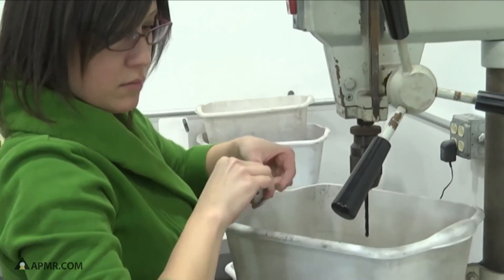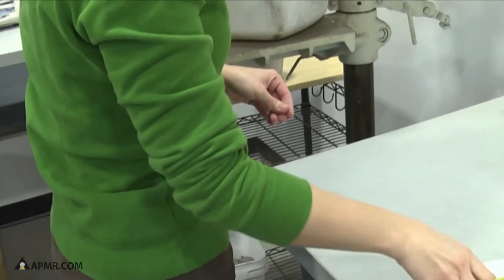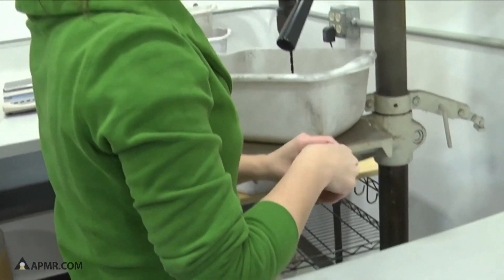Now we're going to drill the bottom side of the bar, get our sample out of the bottom, and collect those shavings in the bag marked B for bottom.